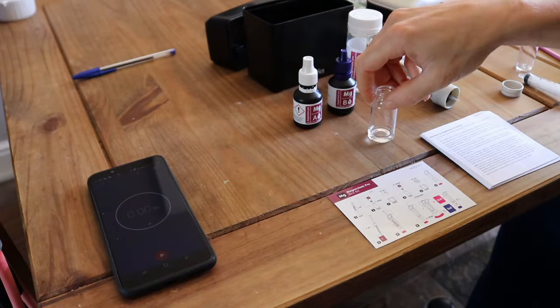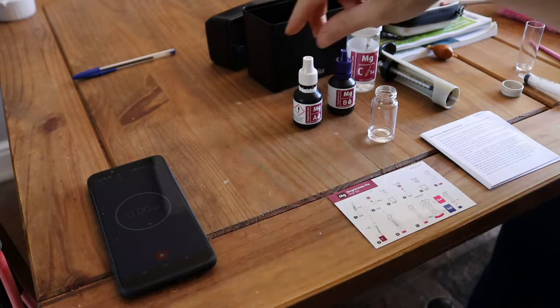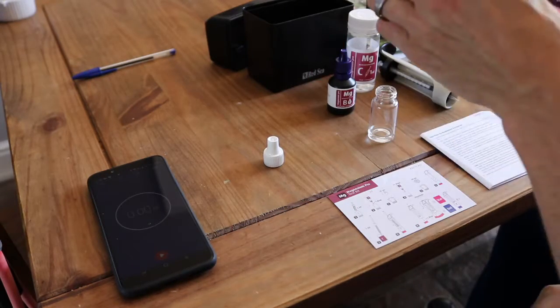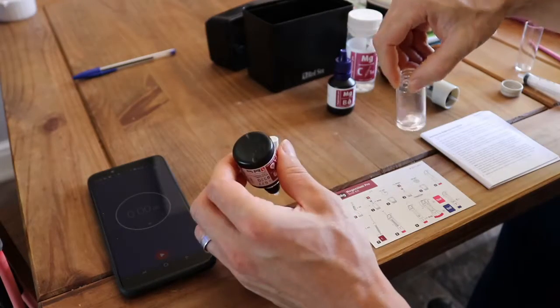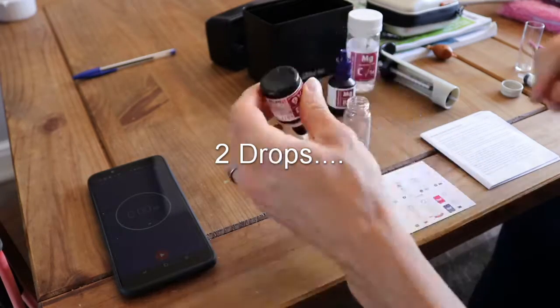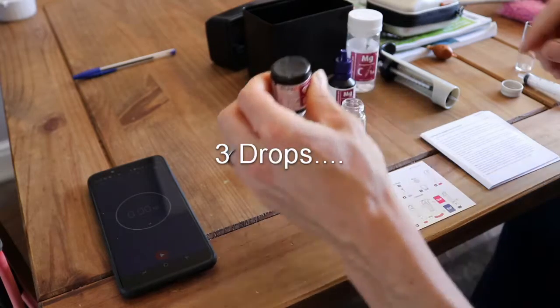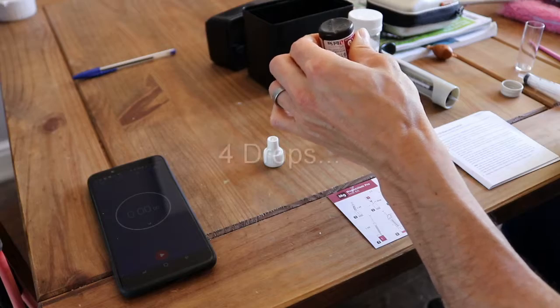So I've already got my 2 mL of water to go, and the main point is to get the colour change, picking up the colour change right. So with your A, you want to be careful as well that you don't get the crappy half bubbles. Fourth drop.